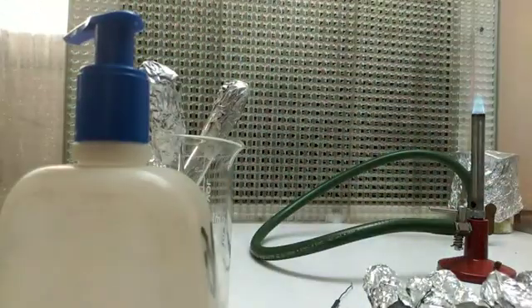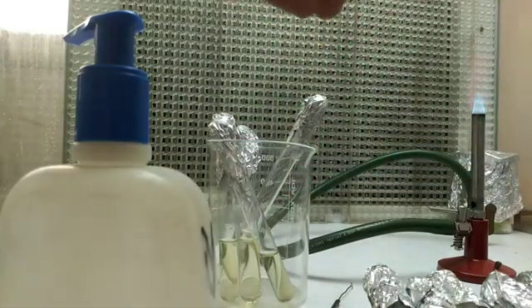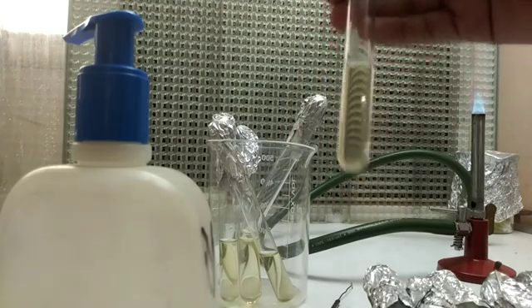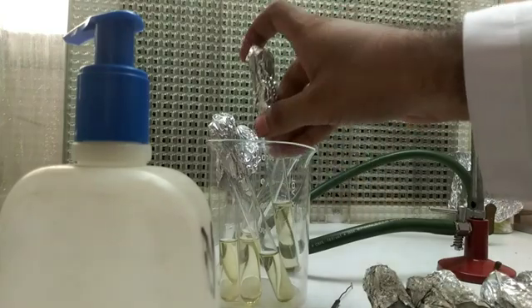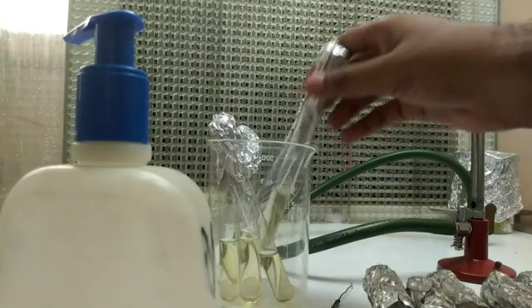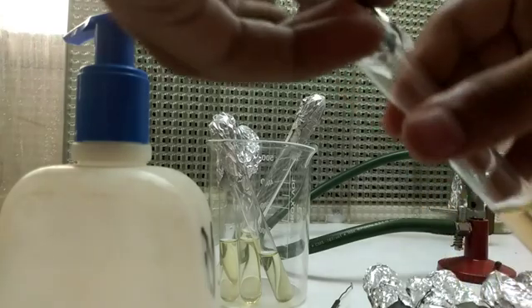After sterilization, clean your hands with 70% alcohol and allow the nutrient broth to cool down to 45–50 degrees Celsius. This ensures that when we inoculate the bacterial culture, the bacteria do not die from high temperature. Wait until you can comfortably touch the test tube with your hands, then open the aluminium foil.